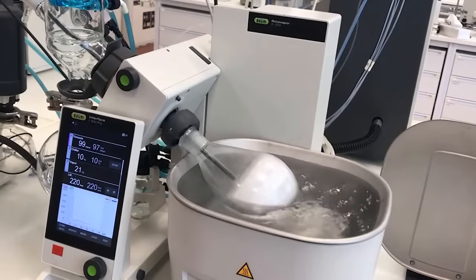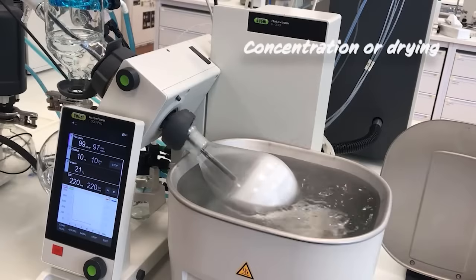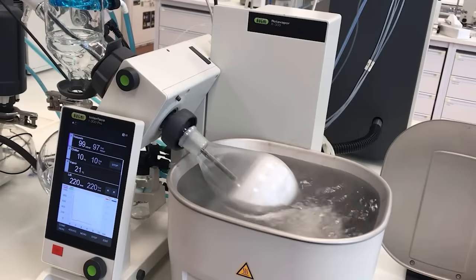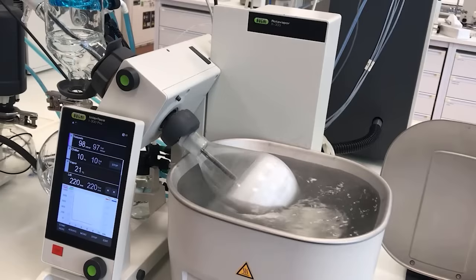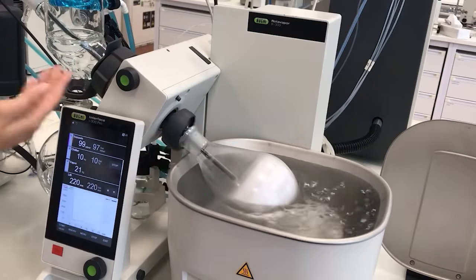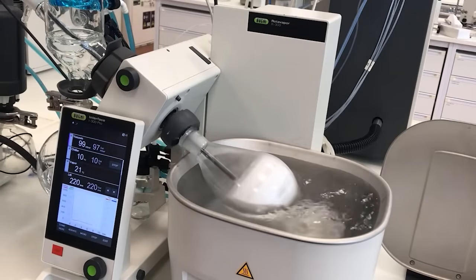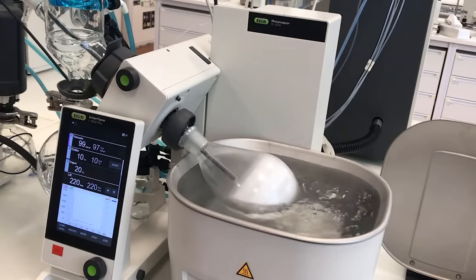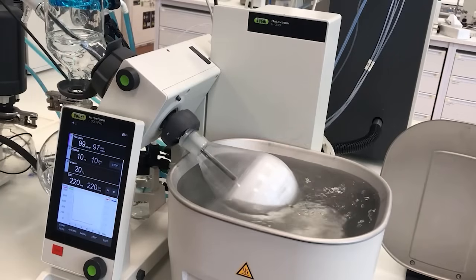Now comes the end of the distillation. We need to choose between concentration or drying. In our case, we needed to dry our sample, so as you can see, the sample is now completely dried and is a white powder. We know the evaporation is finished because there are no condensation droplets falling from the condenser coils, or we can also see this from a sudden decrease of vapor temperature. If you need to concentrate — meaning you need some solvent left in the flask — then you'll have to stop the process before complete dryness.